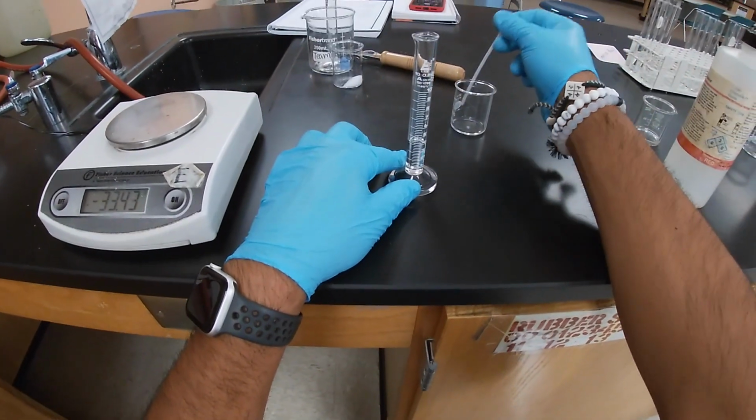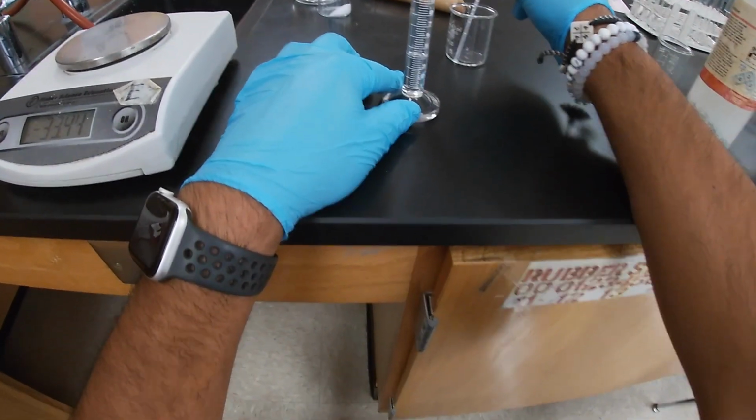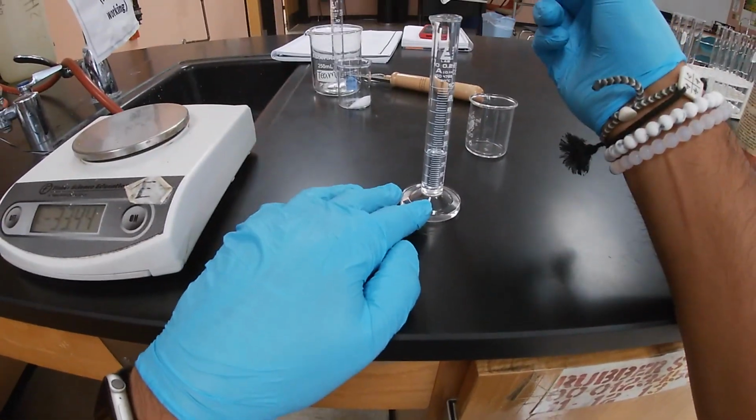I think we might only have enough for 4, so we'll go ahead and just do 4.